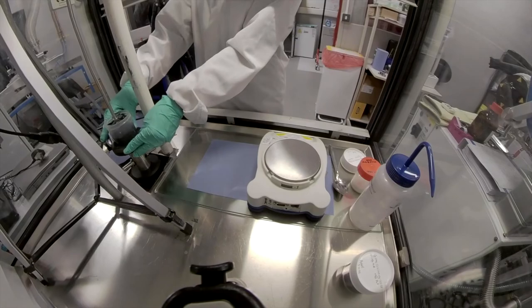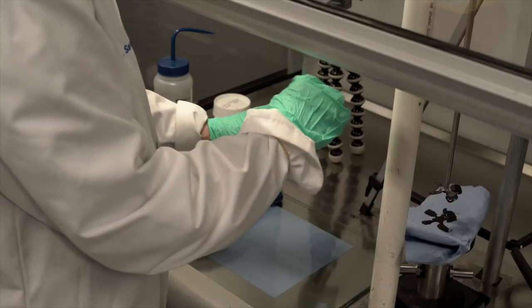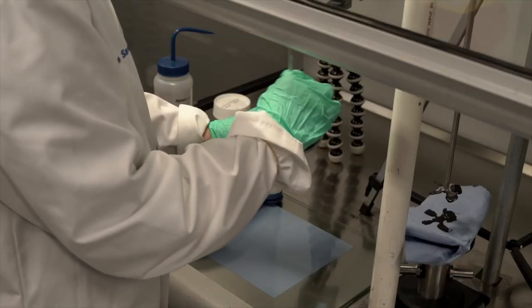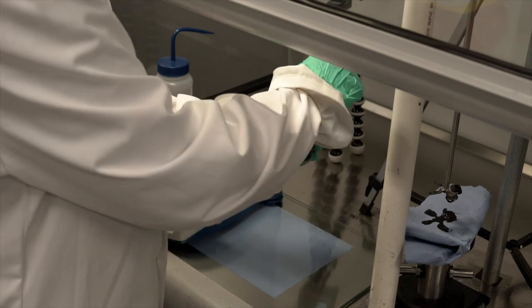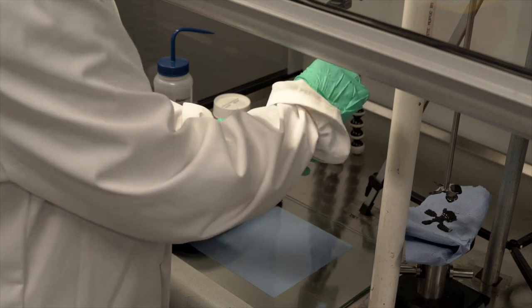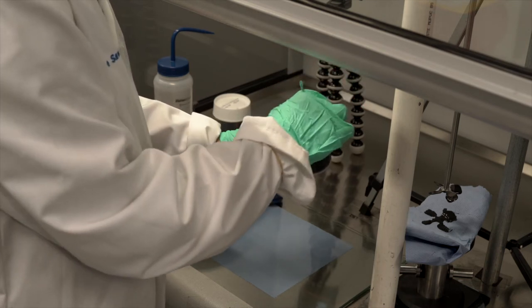So that's five minutes, and that looks very smooth. If I look hard, I might be able to find a clump here or there. But instead of remixing now, I'm actually going to leave this to rest overnight.